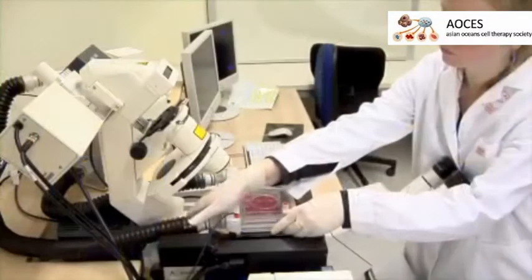We found that each cell population needs slightly different lengths of time until reaching 60 to 80% of cell damage. That's why we suggest to begin with a 2-hour incubation, and if it's not enough, increase the time of OGD. In our case, H9C2 cells typically need 150 to 170 minutes of OGD.